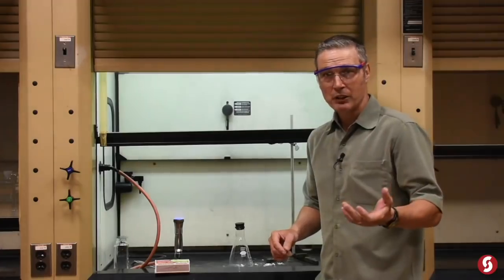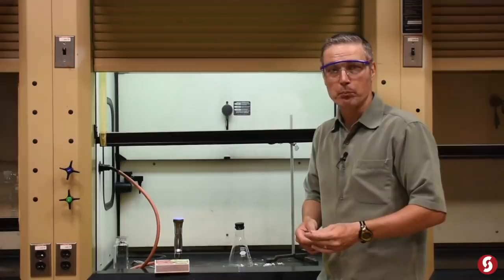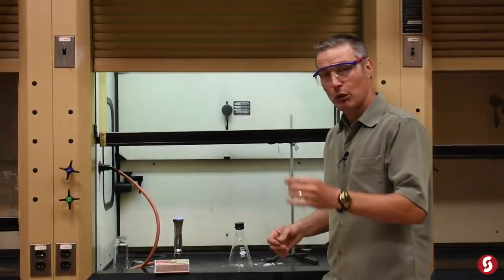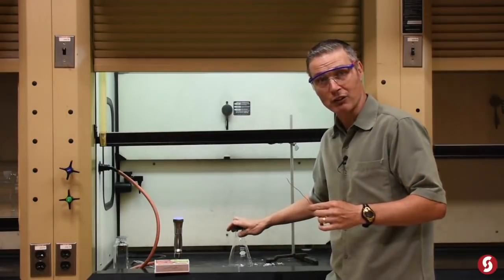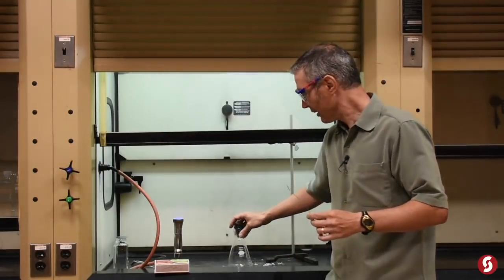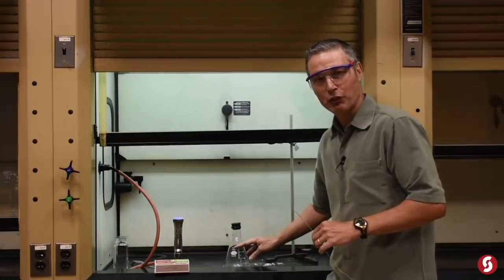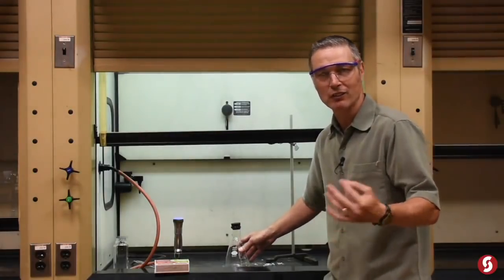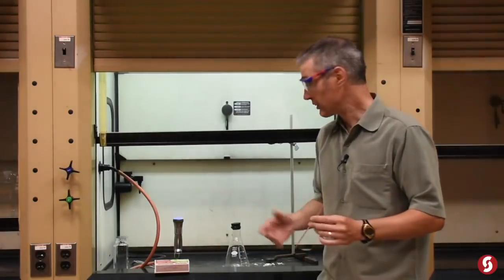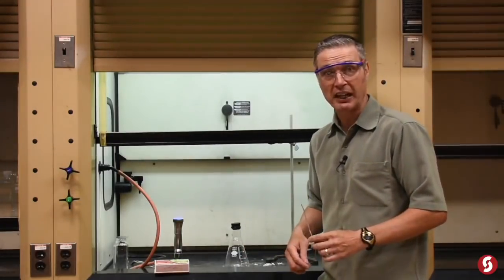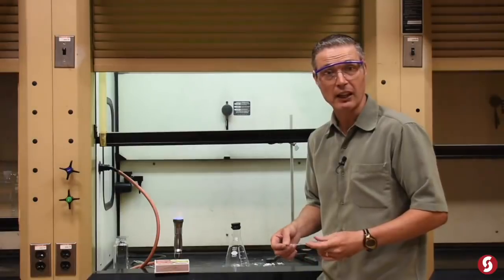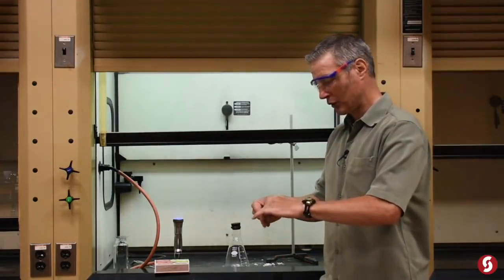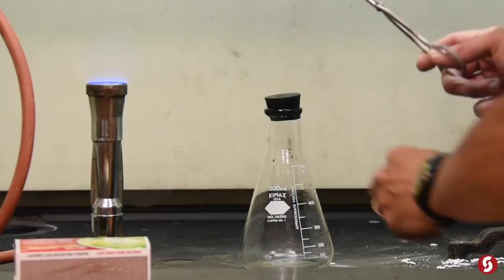Now folks, I got to admit to you, I could have rehearsed this, but I've never in my twenty-three years of teaching chemistry put burning magnesium into pure oxygen. You saw what it did in air, right? Now, what I've got is a little bit more sturdy container. It's made of hard glass, borosilicate glass, but still, that doesn't take away from the fact that I am genuinely frightened right now. But this will be our finale for sure. I think I'm just going to drop it in as a ball.